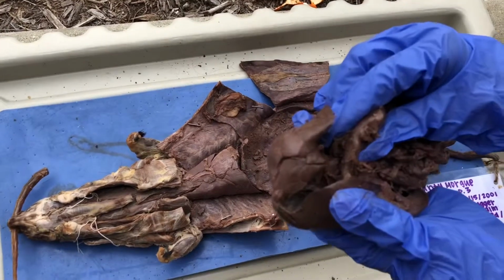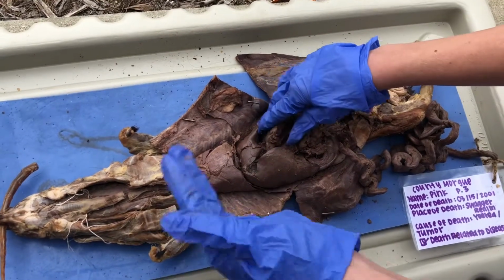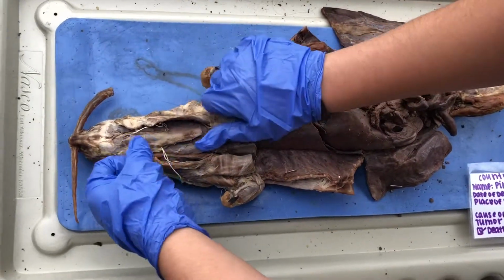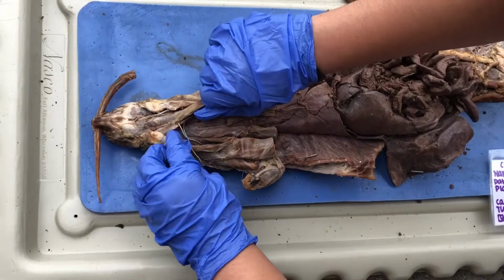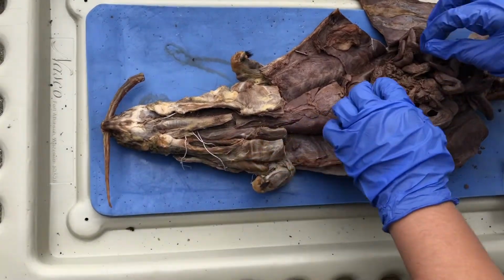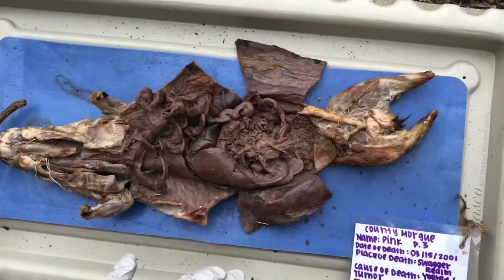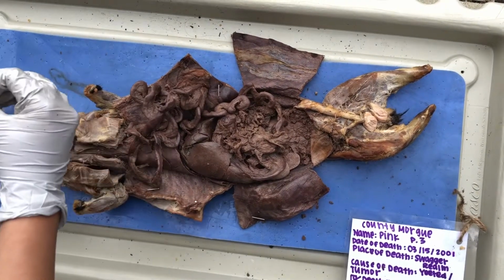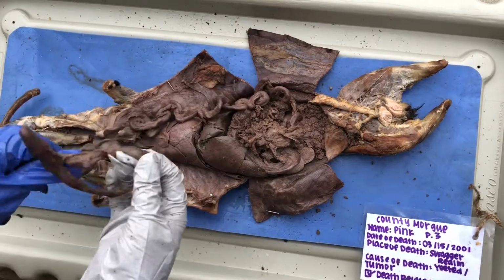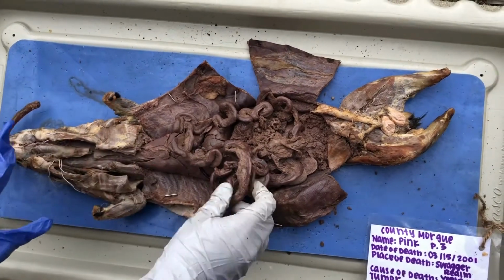Okay, so here would be the stomach. And basically in the stomach, chyme is created through chemical digestion, and then it goes into the duodenum and then into the intestines. Next to the trachea right here is the esophagus. The esophagus is a food tract for when a bolus is in here. It leads all the way down to the stomach, and that's where it would churn food and make it into chyme. Peristalsis is when the bolus, which is the chewed food, gets pushed down in waves through the digestive tract, through the involuntary constriction and then relaxation of the muscles.